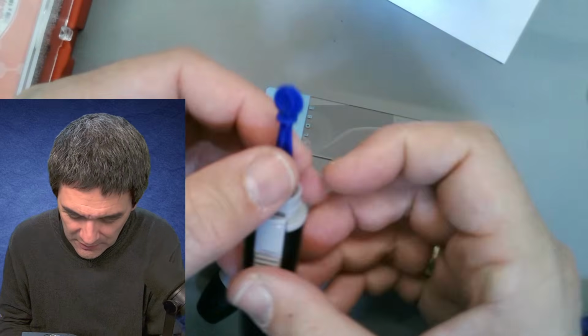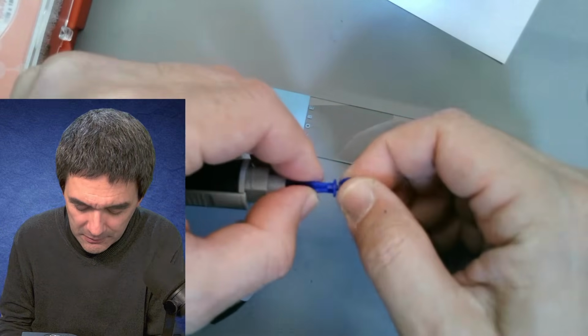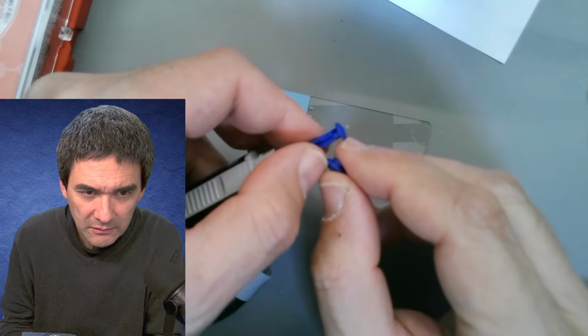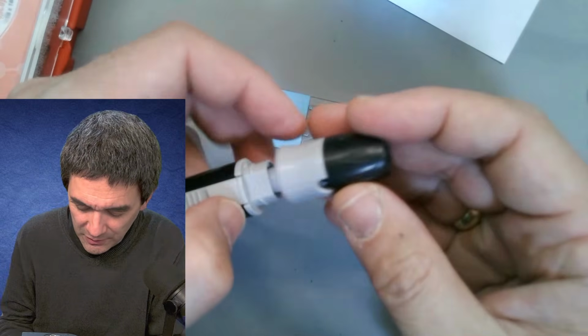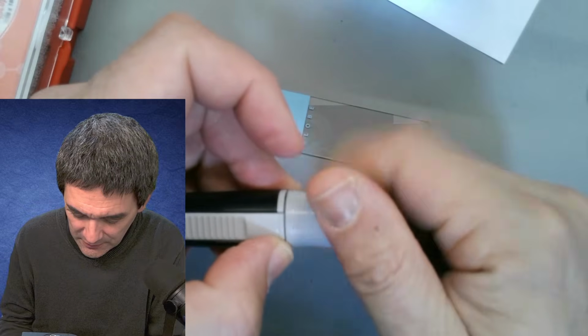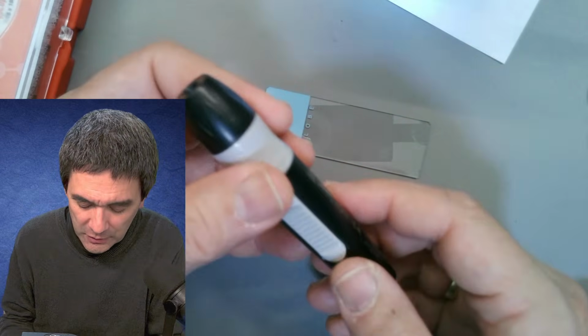Okay. So I have to break off the safety tip. This is the needle, right? Very sharp. I have to put this on here. This is actually there, yeah, so that is for easier. Otherwise, psychologically, it's too difficult.